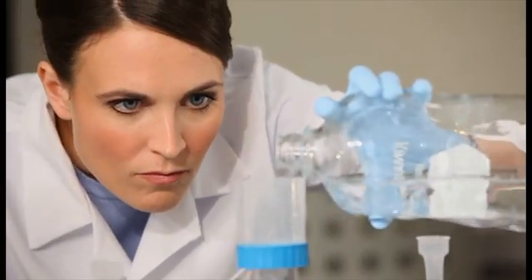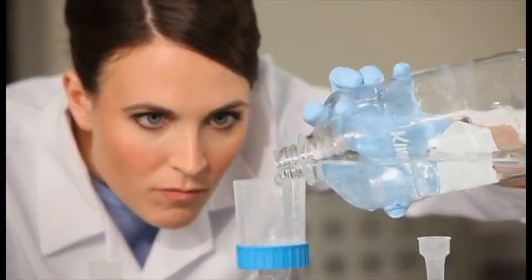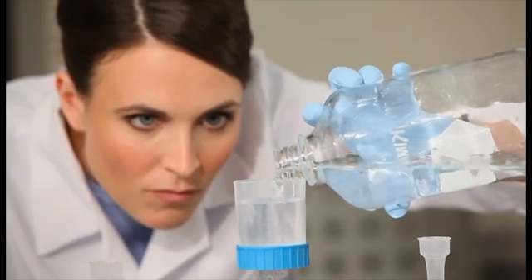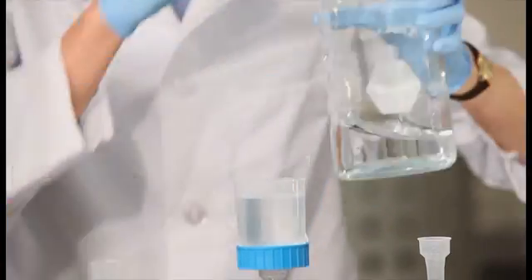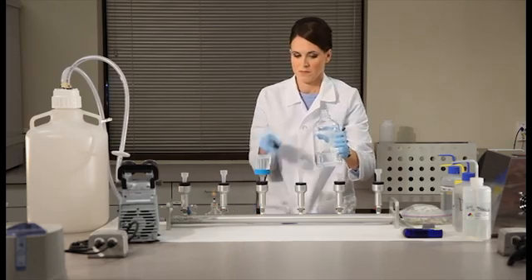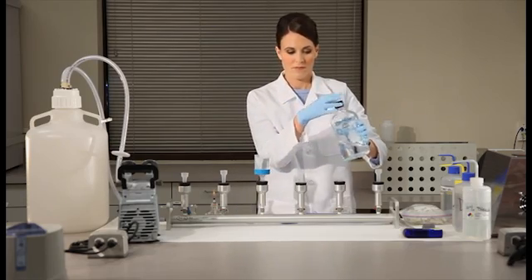Next, pour 100 milliliters of the sample into the funnel. For a negative extraction control, use 100 milliliters of sterile phosphate buffered saline solution in place of the sample water.